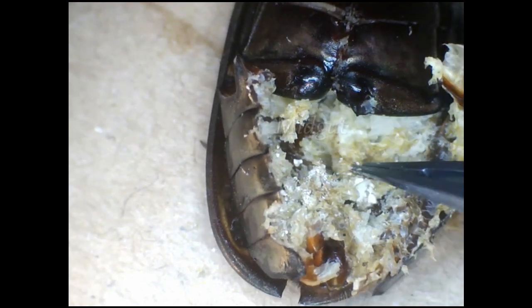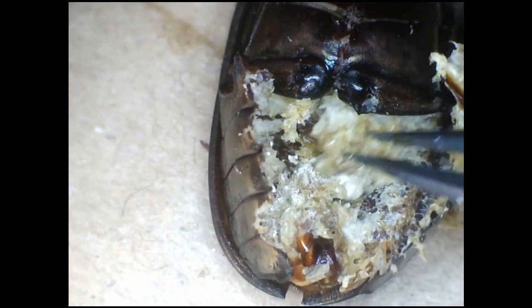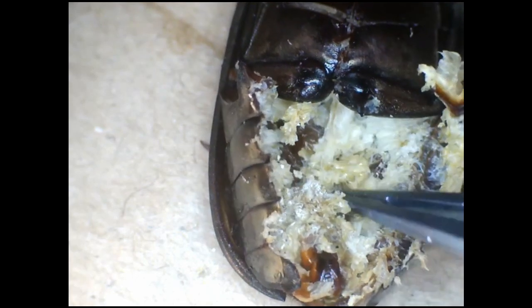Buried in the middle of the fat body, we can see the guts. You can see the thinner midgut at the top, which becomes more bulbous as it turns into the hindgut down here. This hindgut, known as the colon, is extra large in this species because it has to absorb all of that water from the tree sap that these stag beetles feed on. You may now notice lots of white tendrils covering everything — they seem to be originating from the body wall, and that is because they come from those spiracles I showed you earlier. These white tendrils are called tracheoles, and they take air from the spiracles directly to the internal organs. Yes, it's the beetle's respiratory system. Insects don't have lungs — they don't need them. Insects are simply small enough that oxygen can diffuse directly from the atmosphere through these tracheoles directly into insect cells.